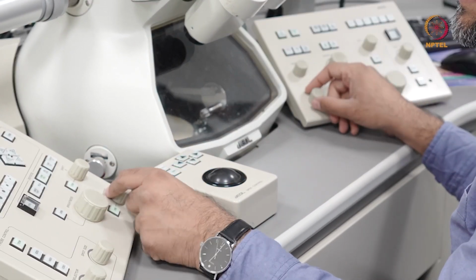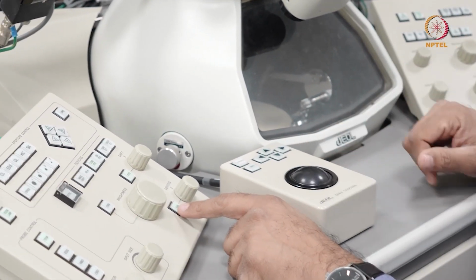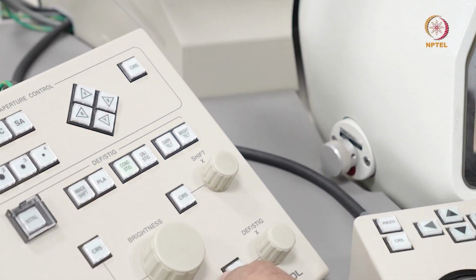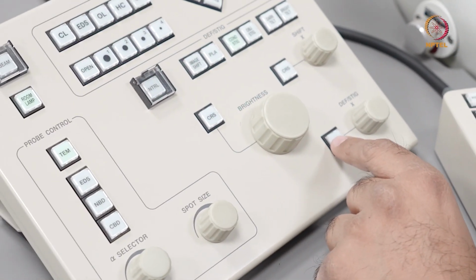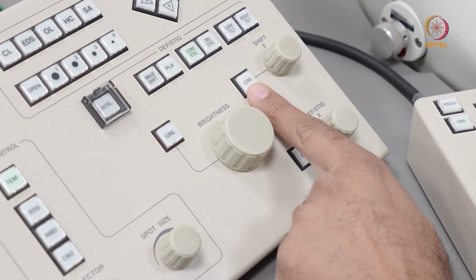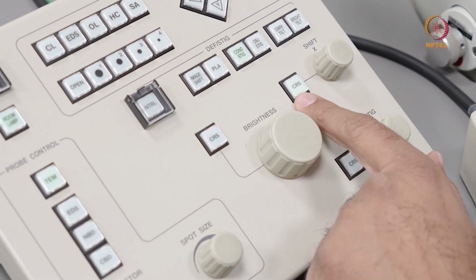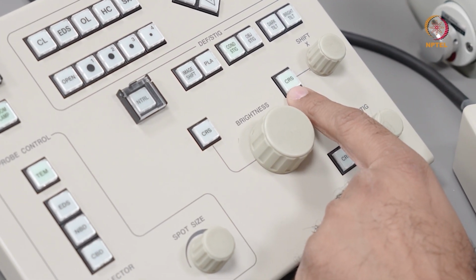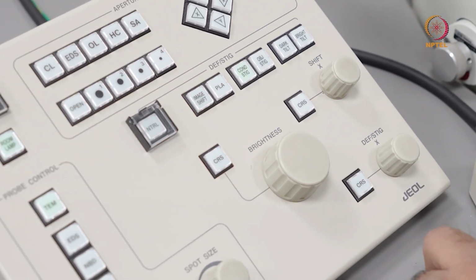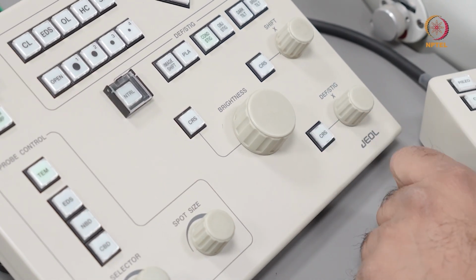And here you have this def/stig knobs. I can choose the step in which I'm causing a shift by pressing this coarse button. So as you can see, the LED backlight goes on here. This means I can shift in bigger steps when this is selected. Likewise, the same applies for the deflection or stigmation knobs.